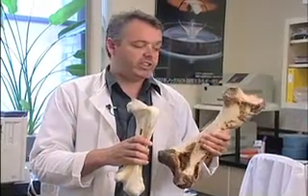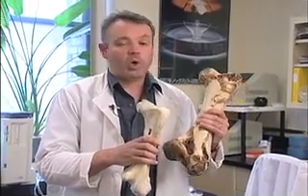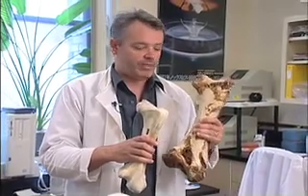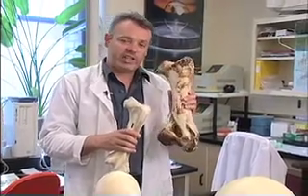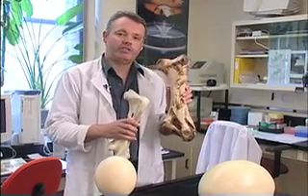And it went extinct, as I said, about 300 to 500 years ago when humans showed up and started to colonize the island. And because there were no mammals or anything else, the moa became one of the major food supplies. Unfortunately, supply did not keep up with demand and they went extinct. Now what we can actually do here in the DNA lab is we can actually extract DNA from these bones and we can look at some interesting questions how moas are related to other large flightless birds.